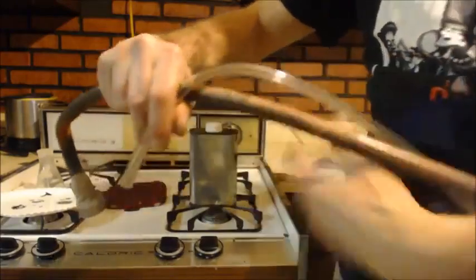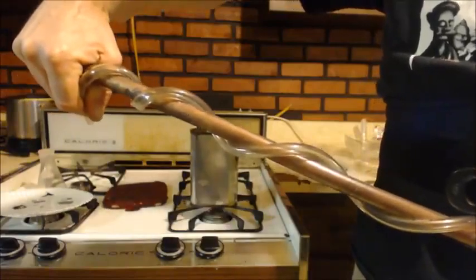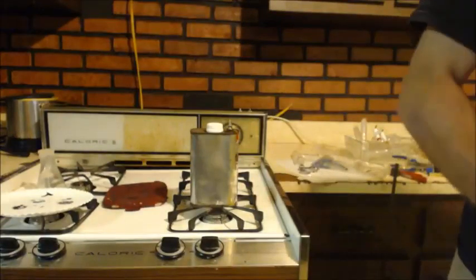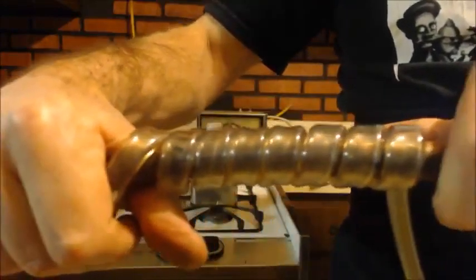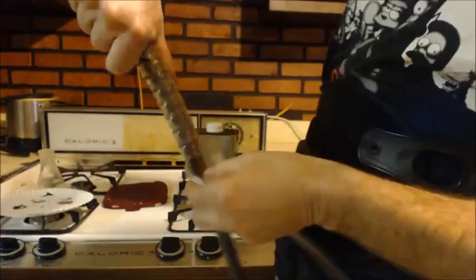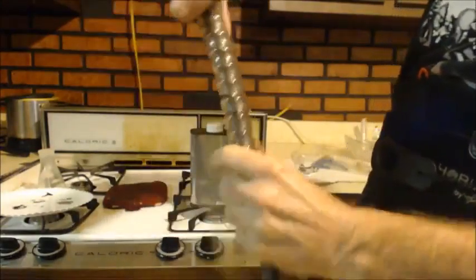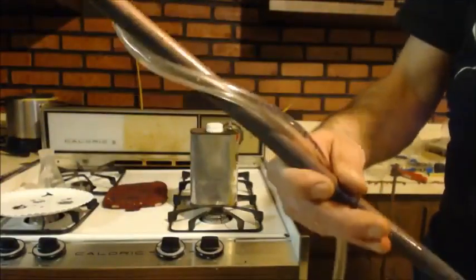And then you just wrap it around. You can wrap it like that if you want to be generic about it. Or, I've actually made one of these. It takes a lot of tubing to do this, though. Or you can wrap it like that, all the way down. See how it's literally touching. See what I'm doing? Just wrapping it around all the way down. And then you'll have ice cold water going all the way around the entire length. You can have it two to three feet if you want.